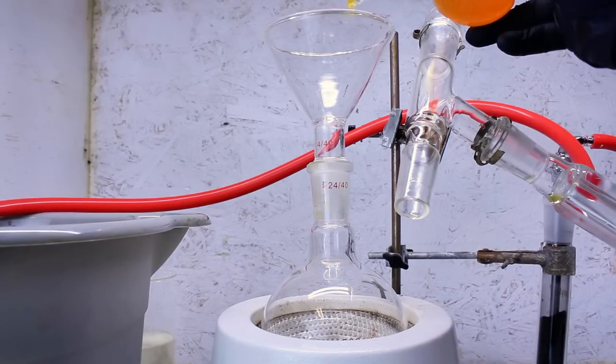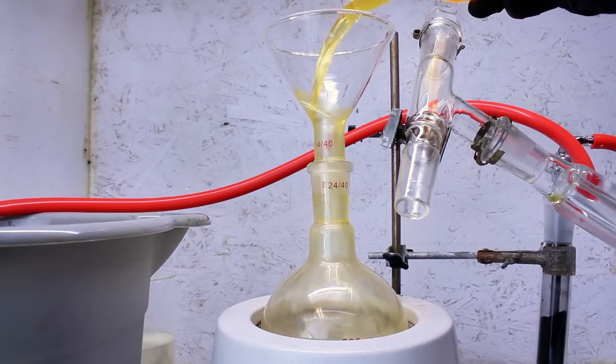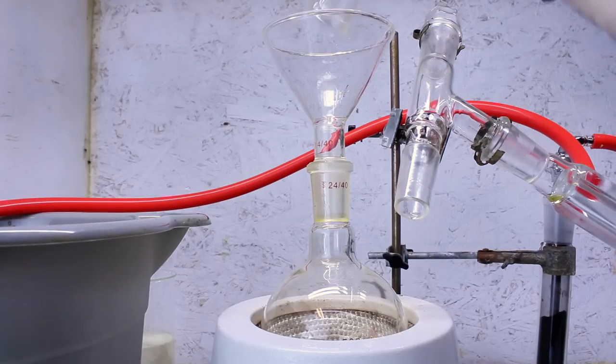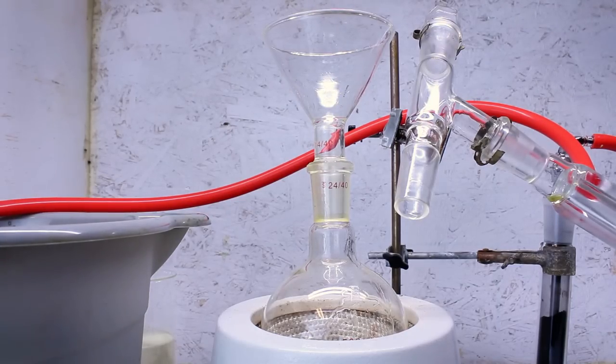As a side note, it's a similar color to the crude benzene from last month, and at the time I chalked that up to iron impurities, but now I'm thinking it might be some weird decomposition products.